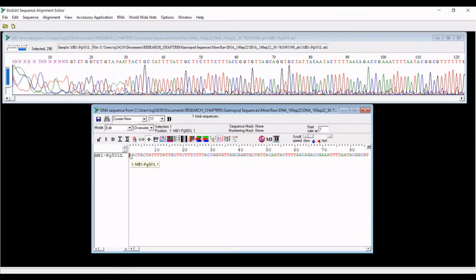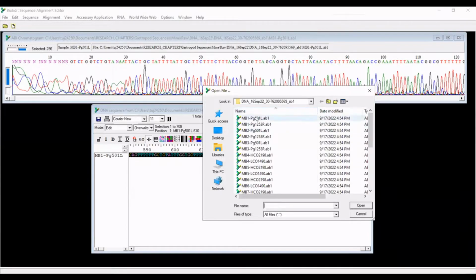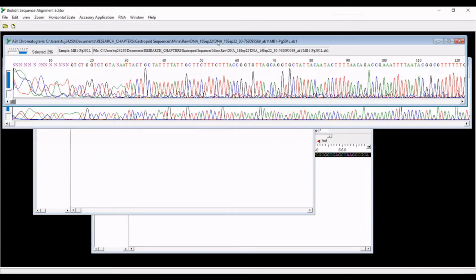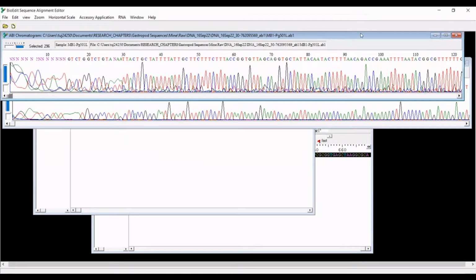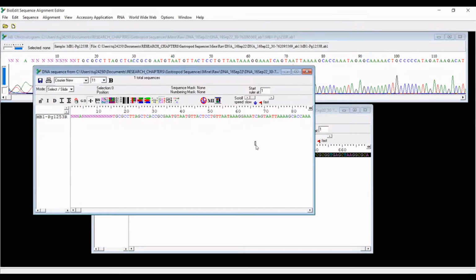So what you want to do now is I'm actually going to copy this whole sequence, okay? So I'm copying it, and I'm going to open another file. So this is from the same day. This is the reverse, okay? And so I have my chromatogram. This is the forward one. I'm going to close that. This is the reverse read. And this is the reverse sequence.